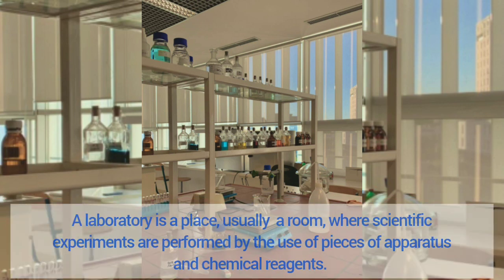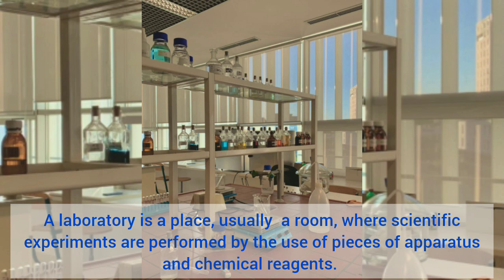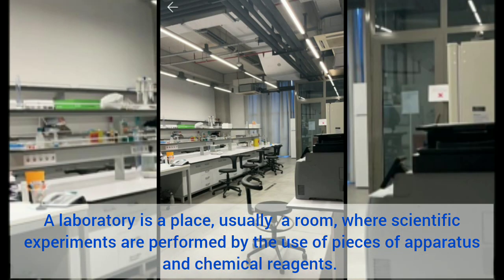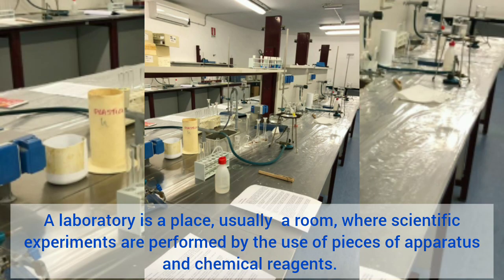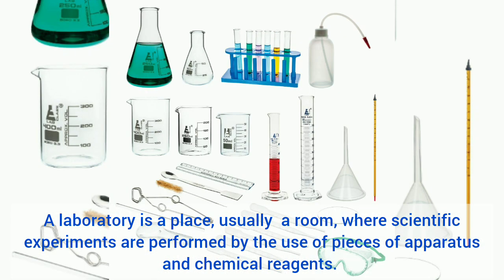A laboratory is a place, usually a room, where scientific experiments are performed by use of pieces of apparatus and chemical reagents. I repeat again, a laboratory is a place, usually a room, where scientific experiments are performed by use of pieces of apparatus and chemical reagents.